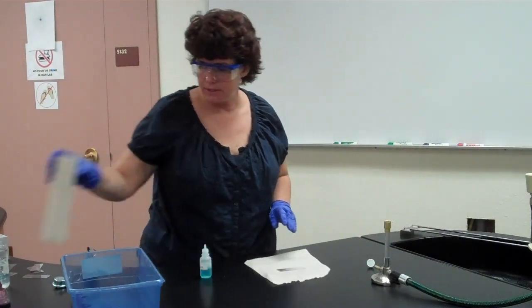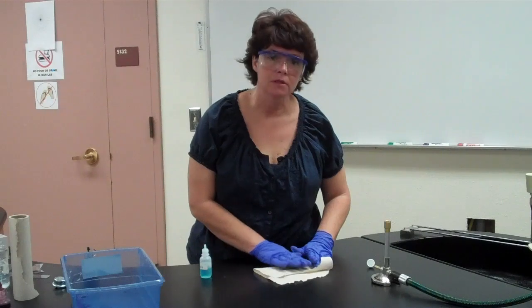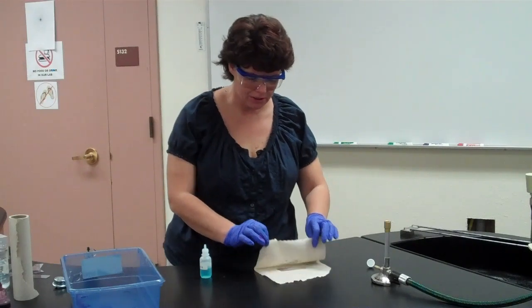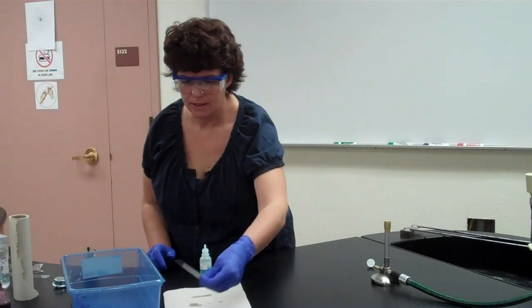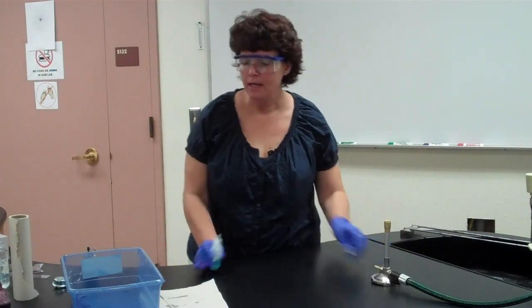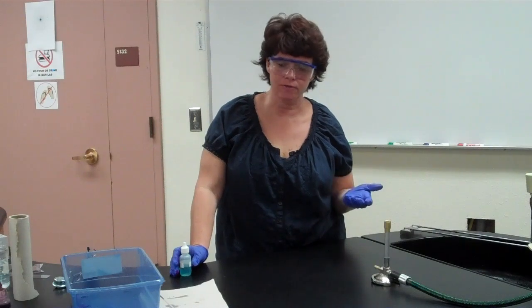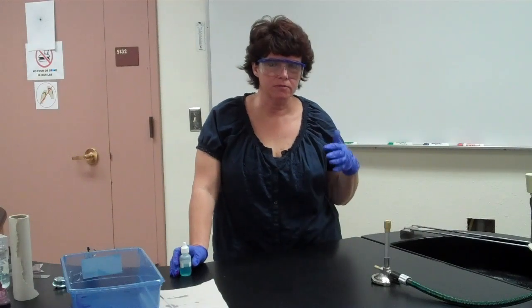When you blot dry, be extra extra gentle because this is not fixed. If you blot too hard you'll end up with nothing on the slide. Just gently blot and then let it air dry by itself. Now, recall from simple staining that bacteria have a negative charge, so a positively charged stain like crystal violet works well. When we put the crystal violet on, it stained the wall of the bacteria and the capsule.